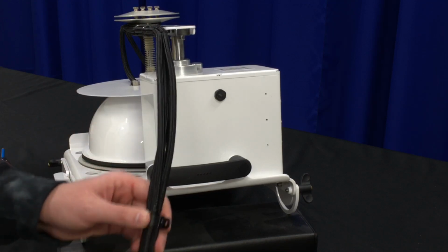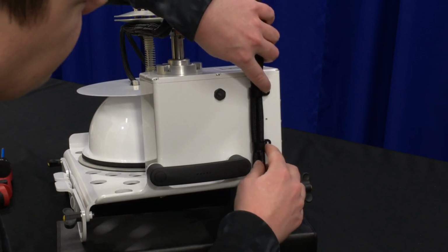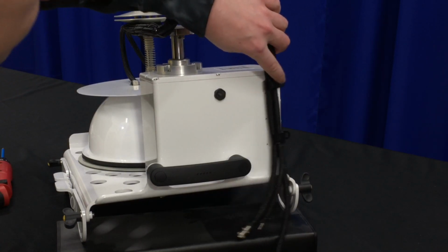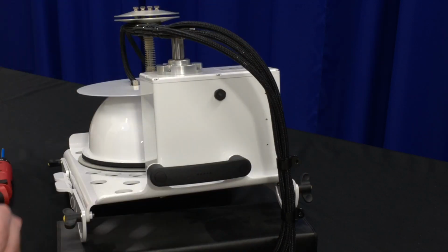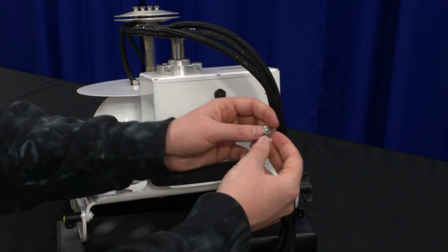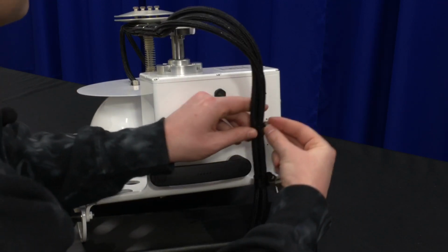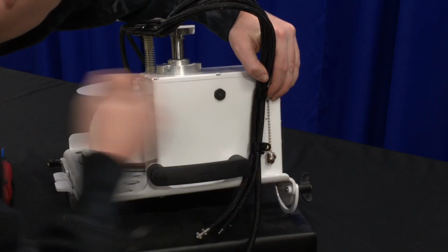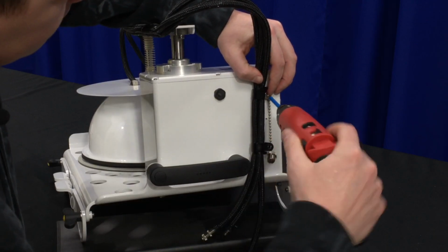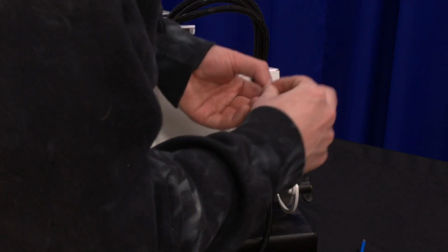And after that, we'll just line this back up. You can start anywhere, but I'll start at the top. You'll want the washer in front of the cap chain for the top screw, and the top is the hardest one to align just because it has the most layers. The second chain doesn't need a washer.